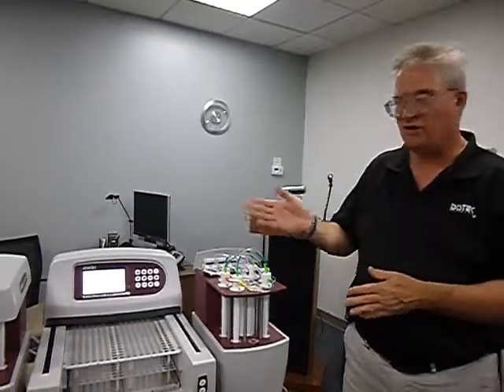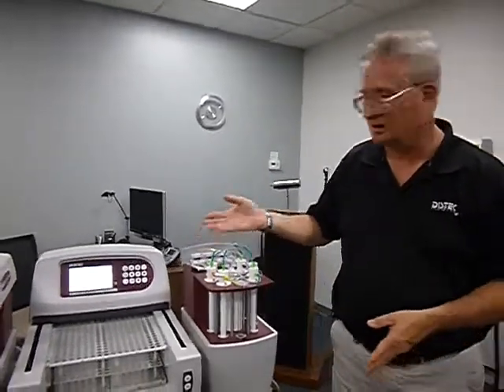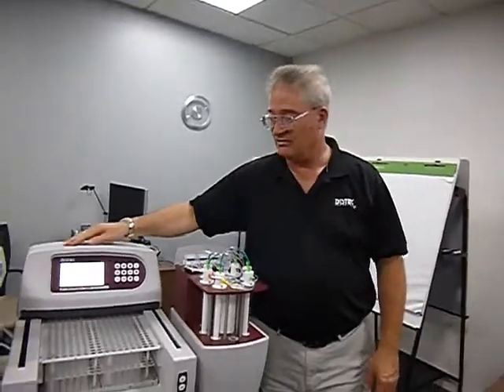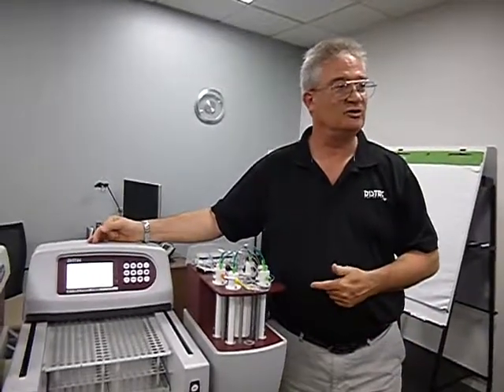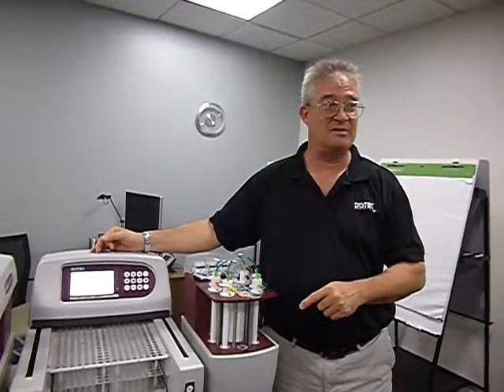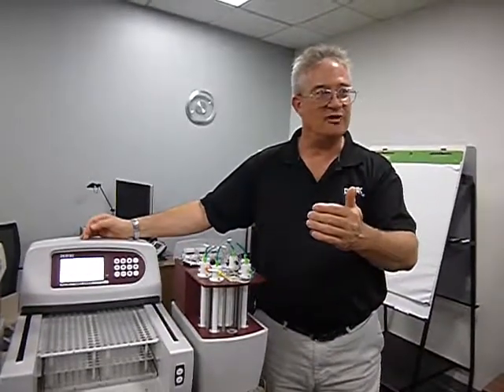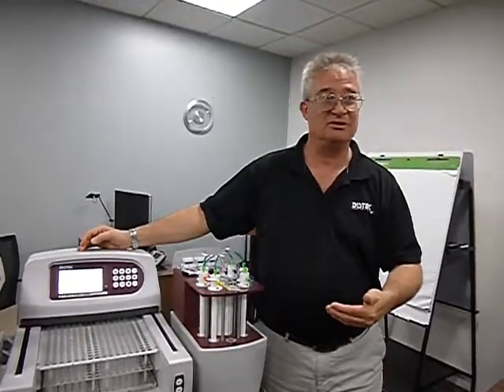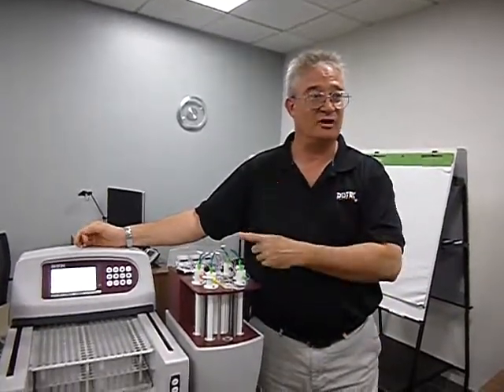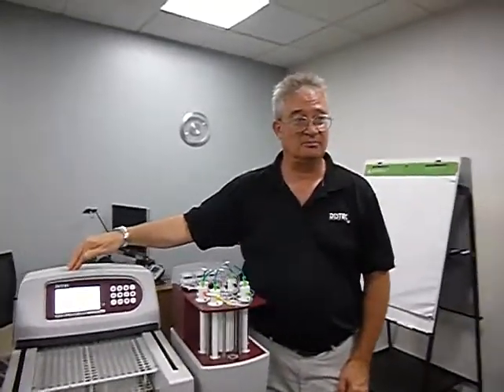But I don't think, I haven't run across it where, I don't know if it tells you that it now will start, or it just will. And then there's times where if you don't have the right settings in here, it'll tell you time conflict, it's self-adjusting. Then you've got to go back into that method, because now it may have made your 5 minute a 4 minute, and your 15, it may have jumped it to 16. Well, there's something else that's off. What you set as your speed makes all the difference in the world.